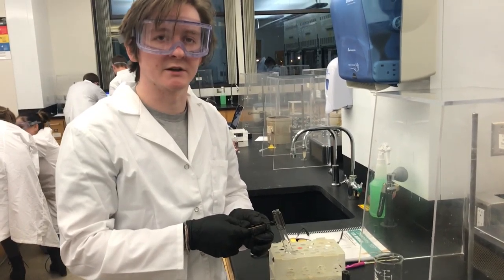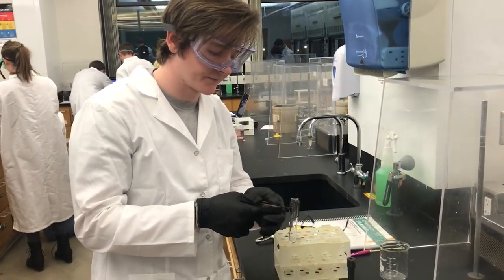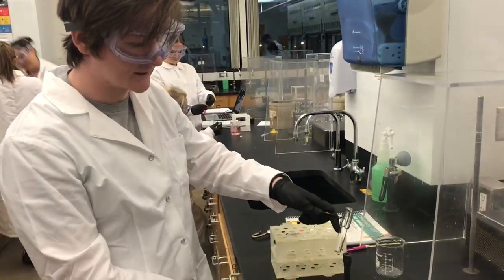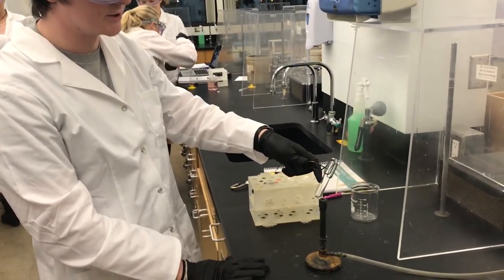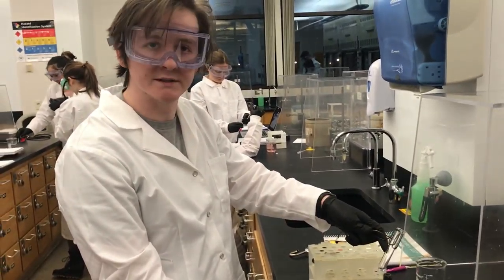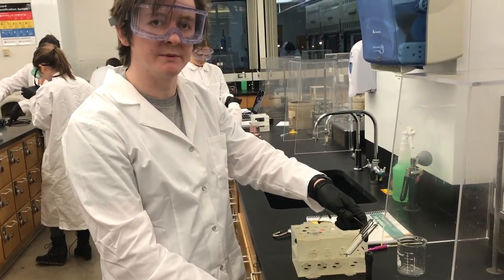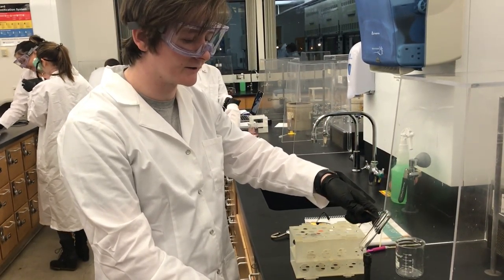The first thing you have to make sure is that you always use a test tube clamp because it's very hot. When you place it over the Bunsen burner, over the flame, you go back and forth at the length of the test tube so that the glass doesn't heat up at one specific spot — it's the whole solution. And you always make sure the opening of your test tube is away from any people around you.